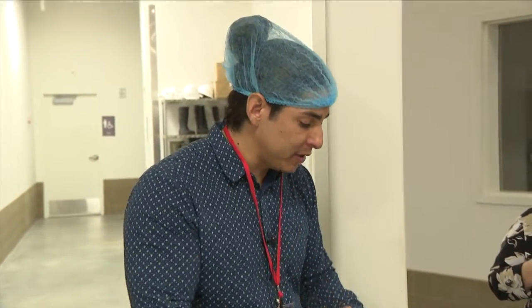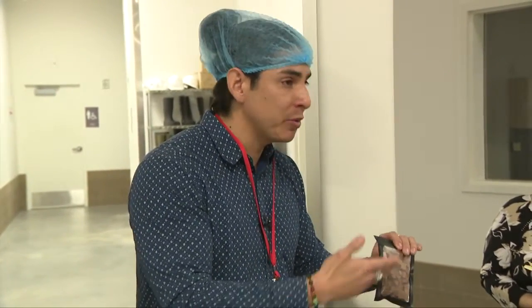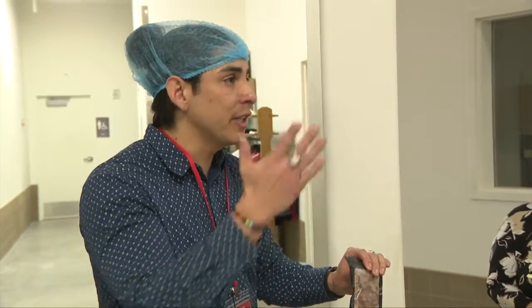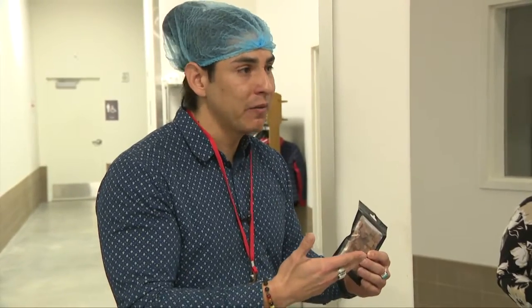When you prep the sample and put it into one of these sample cups, you want to do that quickly, because if you allow it to sit out in the environment, it automatically starts to come to equilibrium with the surroundings. If the humidity in here is, say, 30%, that means the product will eventually try to come to a 0.3 water activity. Water activity is equal to relative humidity, and it's constantly trying to equilibrate — but we can slow that by choosing the correct packaging.